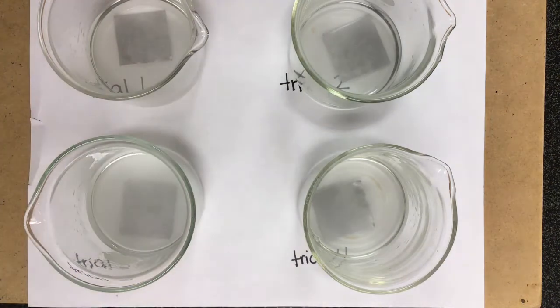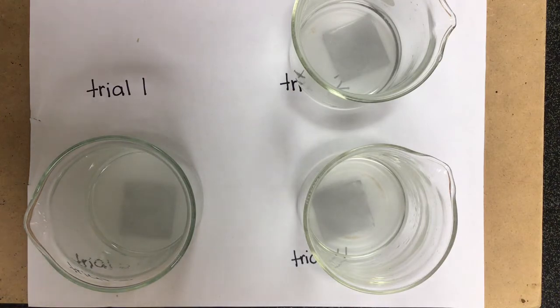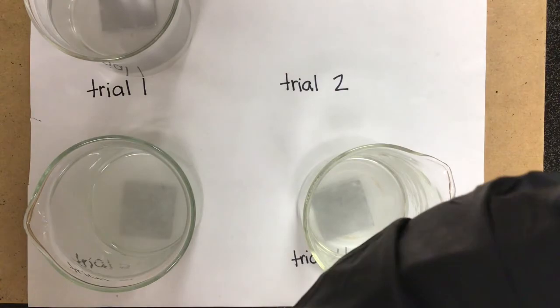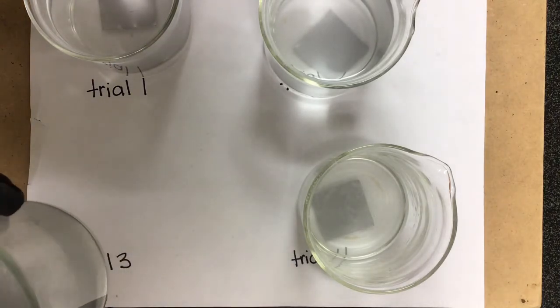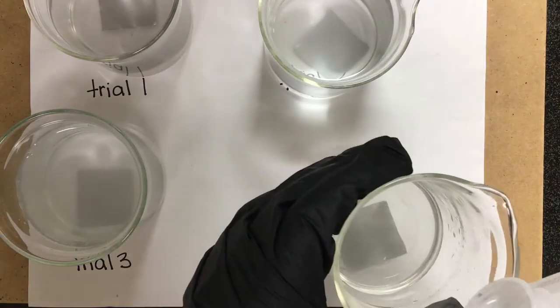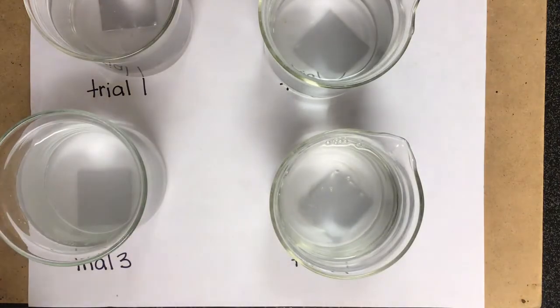Okay, I'm gonna go ahead and pour about 200 milliliters of distilled water in just to neutralize this. It's not really gonna neutralize it. That was a bad choice of words. It will dilute it, but it will not neutralize it. So we're gonna dilute the acid here just to slow down the reaction. And doing that in the exact same order, so these will have been exposed for about the same length of time. Plenty of room for error, even just within that procedure.